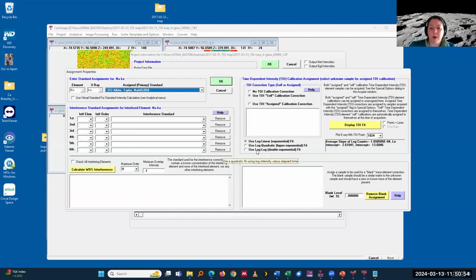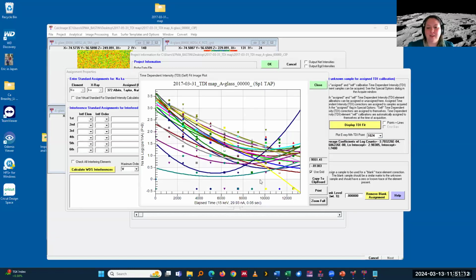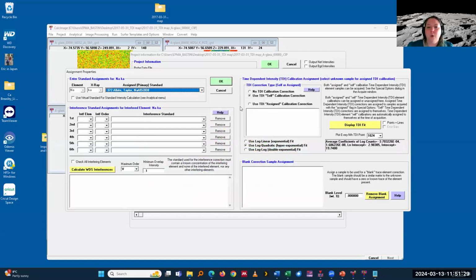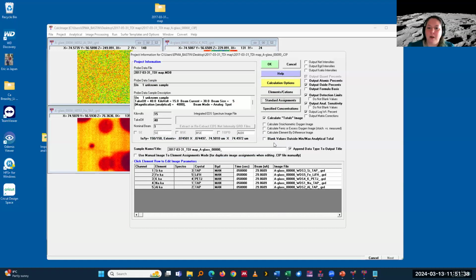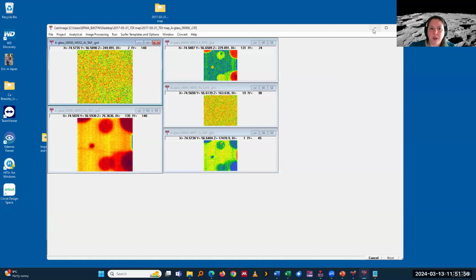Just as in the spot analysis interface, I then decide what I want. I can't necessarily look at each individual pixel to see what makes sense. Specifically, if I have multiple different phases in my map, I might see very different fits in this window, because some are specific to the beam sensitive phase, which might be surrounded by non-beam sensitive phases. So what I do is process it in maybe one or two different ways and let the data speak for itself, where I can have the TDI percent error and whatnot shown, and see if I pick the right values. Okay, good. That's essentially all there is to it.